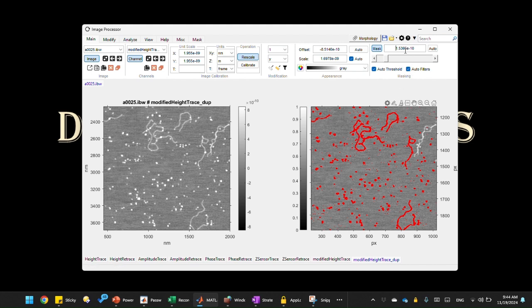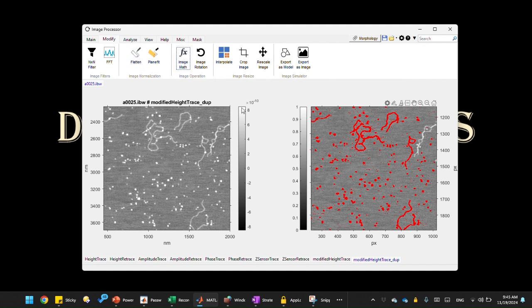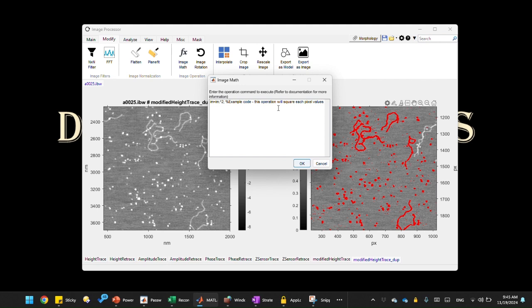So let's take this value and use this to create our mask. Let's copy that number. It's 0.15 nanometer. Let's go back to the image math dialog, and here I'm going to perform the operation. To create a mask, we need to perform a logical operation. So any value that's larger than the value that we just used is 1. This is our logical operation: anything smaller than this number will be 0, and anything larger than that will be 1.